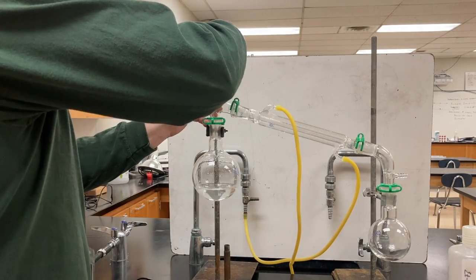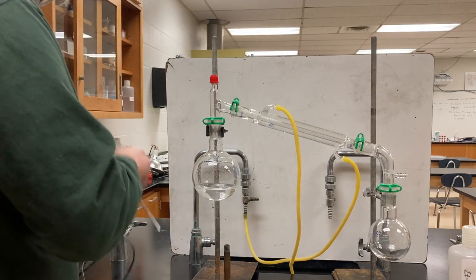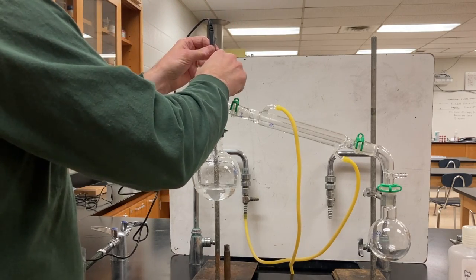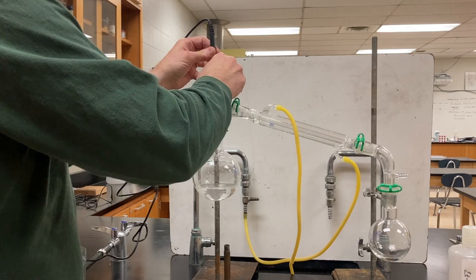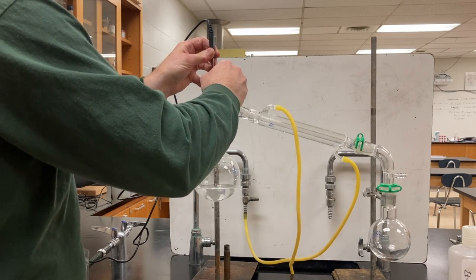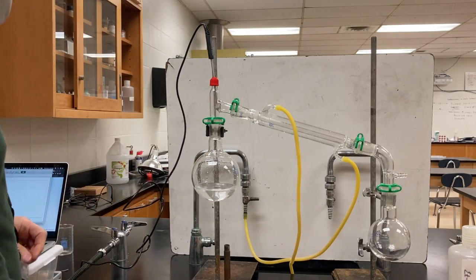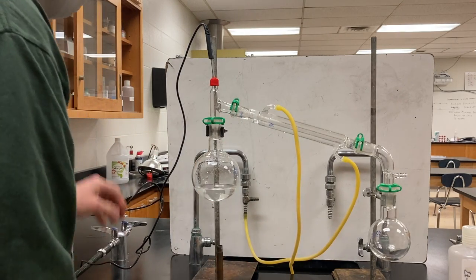And I have assembled this whole thing ahead of time according to the instructions in a different video. I'm now inserting a temperature probe, and I'm going to put this probe above the liquid quite a ways. So it's going to lag a little bit behind the temperature of the actual liquid, but it'll give the temperature of the vapor above the liquid.